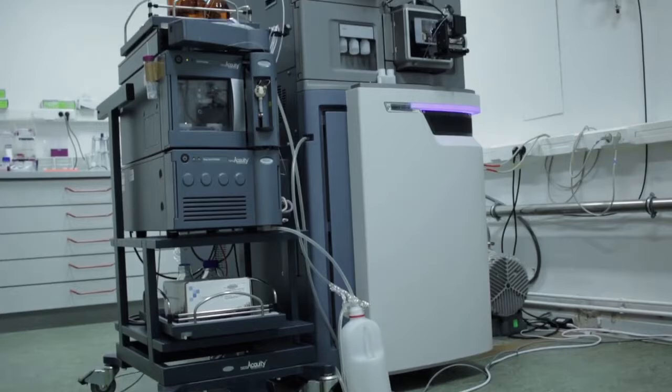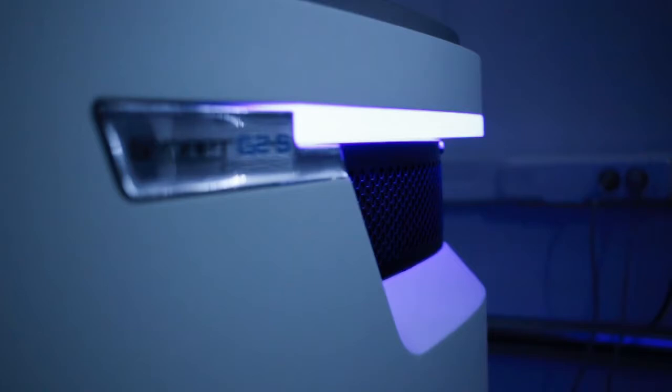The instrument we are mostly using in our lab is an ion mobility mass spectrometry instrument, the so-called Synapt G2S by Waters. It is now five years old but it has no special name in our group, because our boss believes that once you give it a real name it starts to make trouble — and so far he's been right.